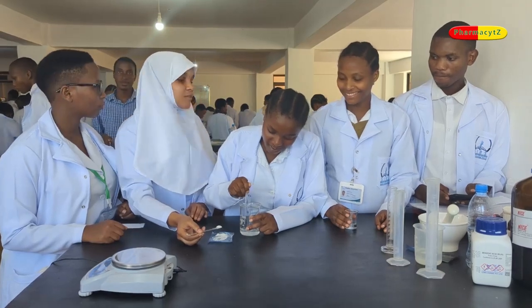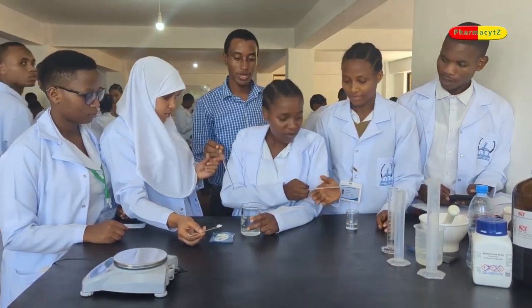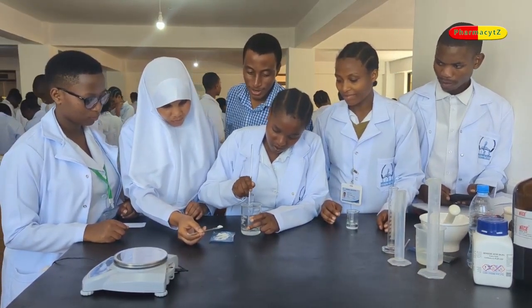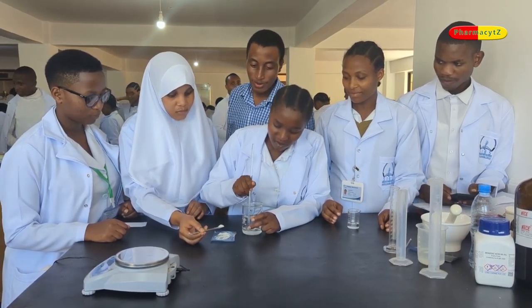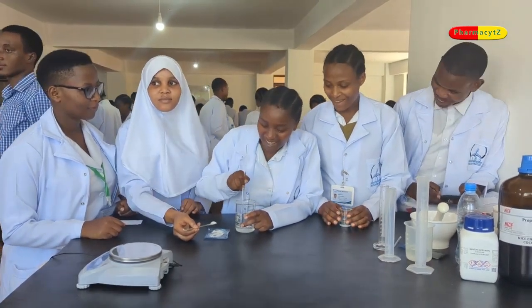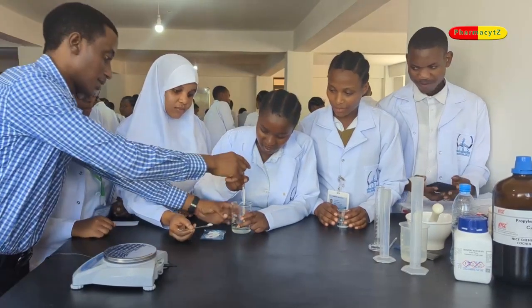When you are done with adding water, make up the final volume with the aid of the vehicle. In this case, this is water. A single mistake will lead to cracking and crystallization of your preparation. Mind each step. As an instructor, you need to be present and instruct your students with all provided instructions.